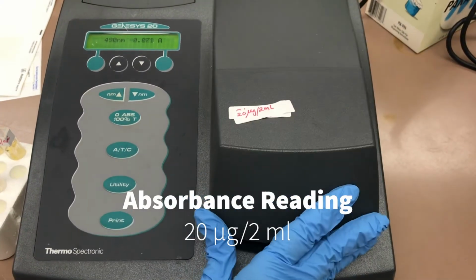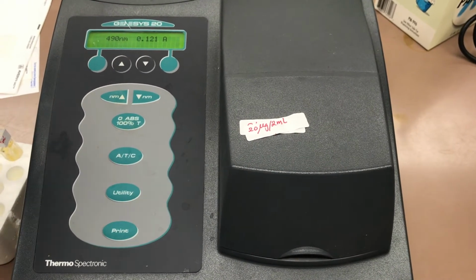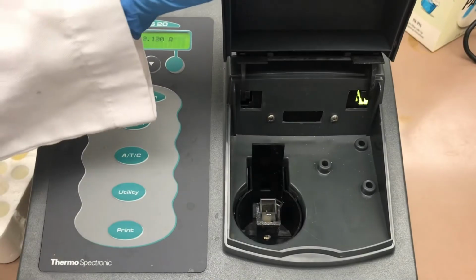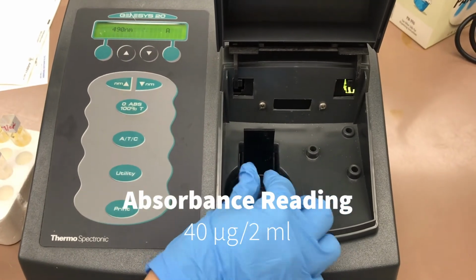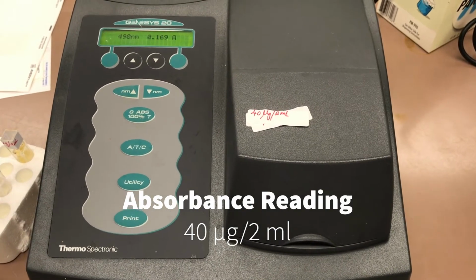This is the absorbance reading for 20 micrograms of glucose per 2 milliliters. This is the absorbance reading for 40 micrograms of glucose per 2 milliliters.